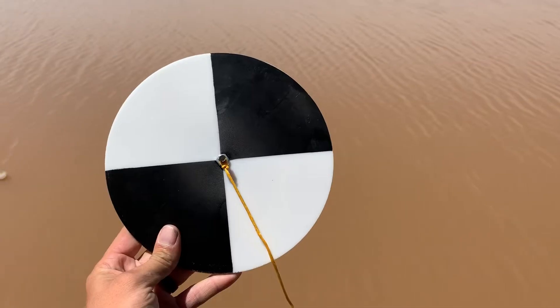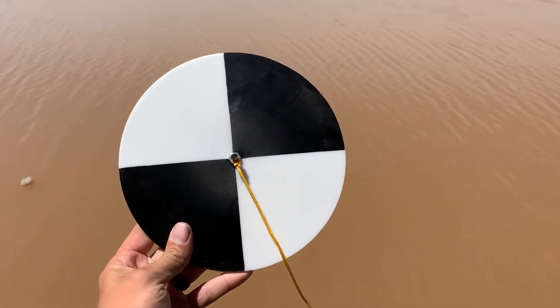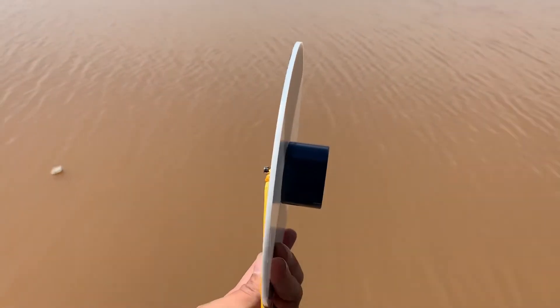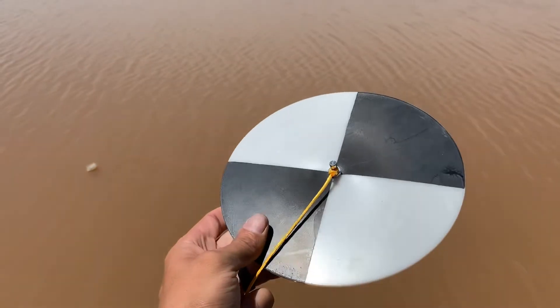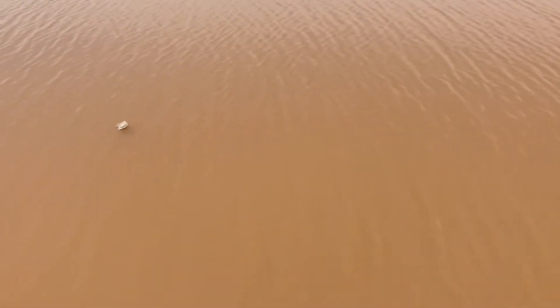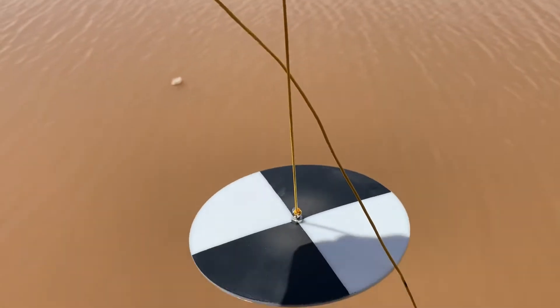Welcome back to the channel. Today we have a quick tip video on how to use a Secchi disc to measure turbidity in your pond. A Secchi disc is a really easy tool — it's a round circle with black and white triangles on it, weighted on the bottom, and has a rope attached to it. You use it to measure the visibility of your pond.